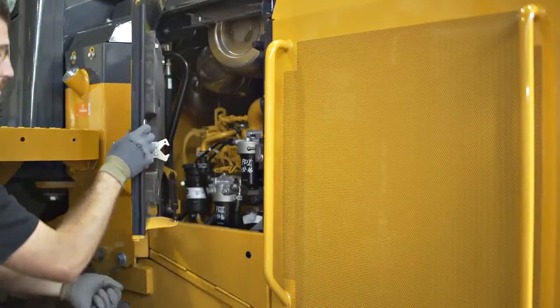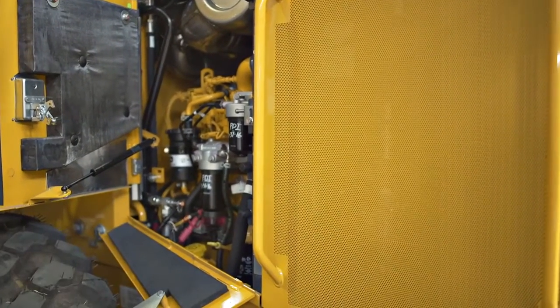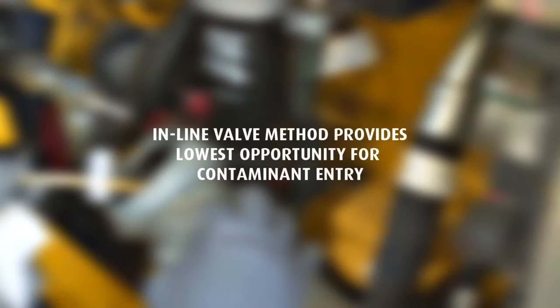The inline valve method is perhaps the most desirable method to obtain a sample. This method provides the lowest opportunity for contaminant entry due to sampling activity that would throw off your results.